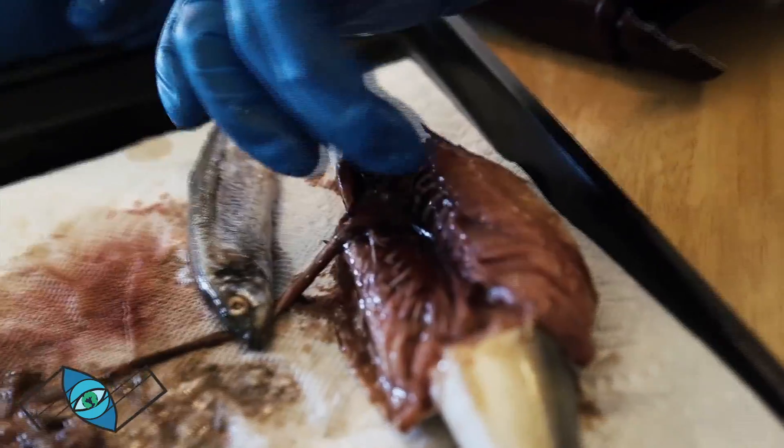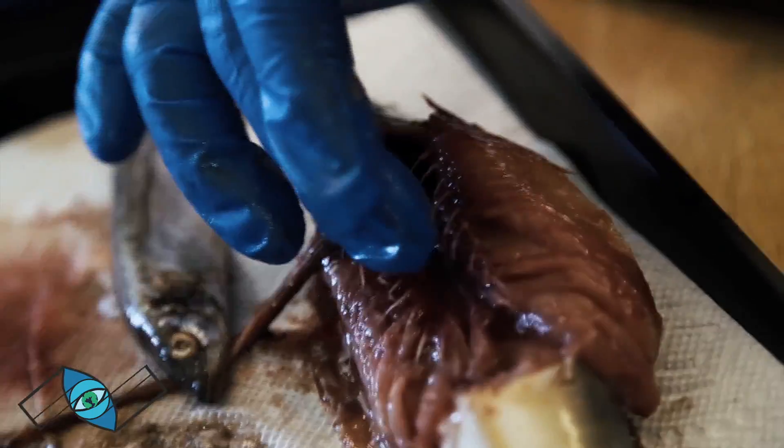But they have a set of jaws here which will allow them to break it up and slowly digest it inside of their guts. And that's what all these bits and pieces are here for, to aid in digestion.